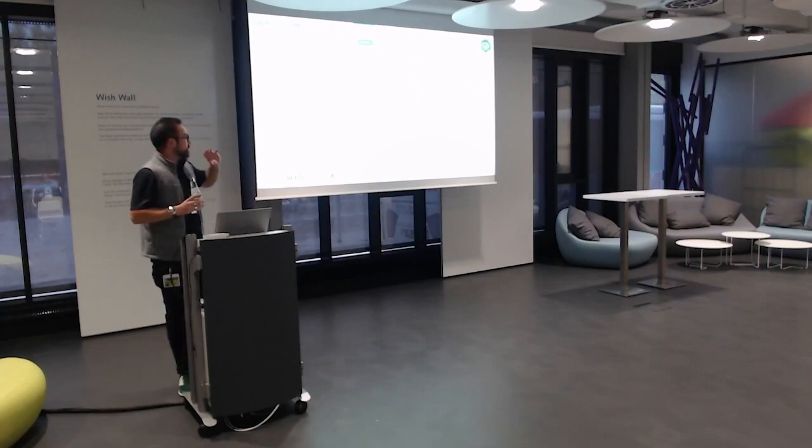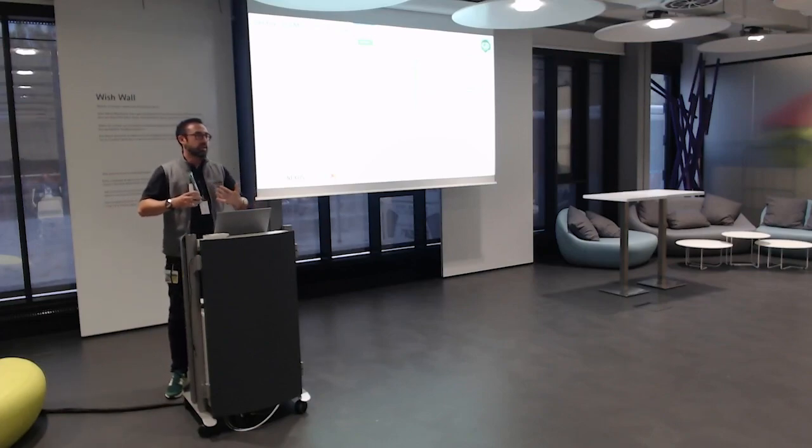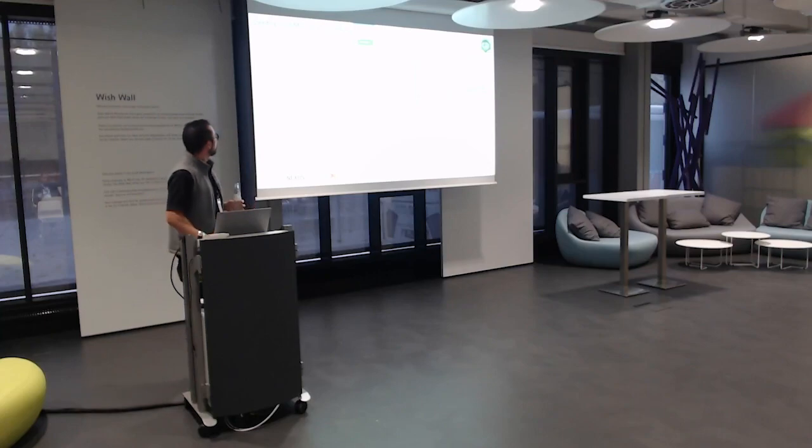So our intent when starting to work with HELM in the context of Signals Notebook, right? So it's an enterprise tool. It needs some enterprise data management layer. That is to say, libraries should be set at the company level, should be managed by somebody who's a curator, who's going to maintain the library, make changes to the library, update maybe monomers as research evolves. But the end users should only consume the content of curated libraries. Only certain persons should be allowed to actually modify the names or bring in new entities into the libraries. So that is something that we'll see in a second.